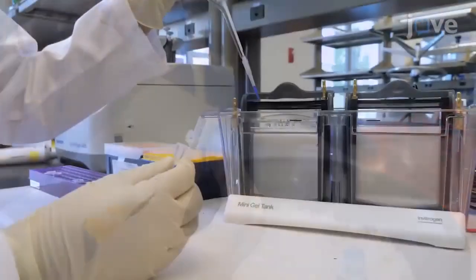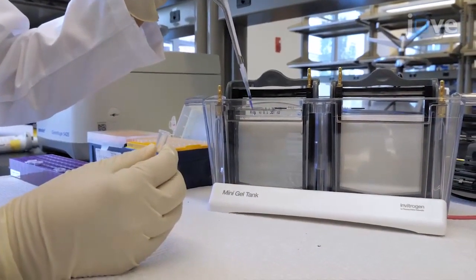Optimizing the cDNA libraries from low-input material is a crucial step for a successful sequencing run. It is therefore very important to generate high-quality cDNA libraries to get accurate results.